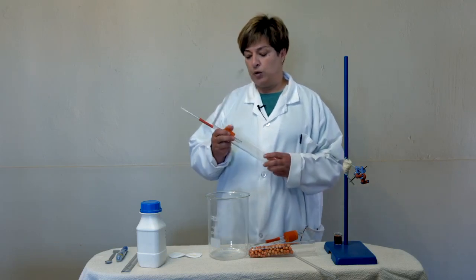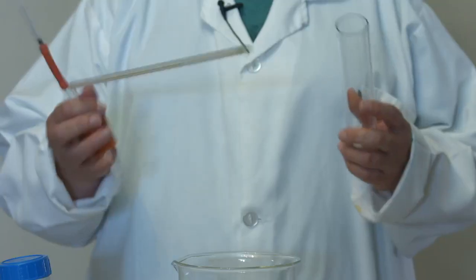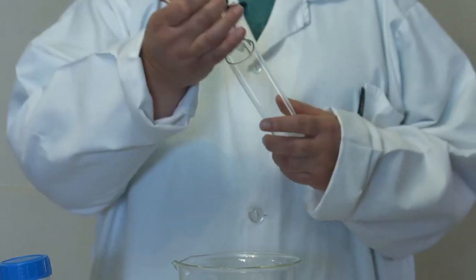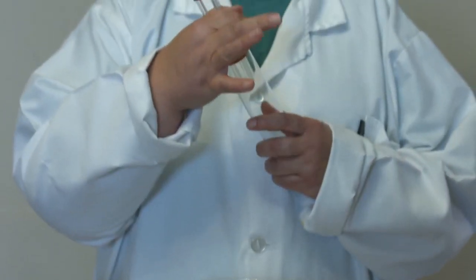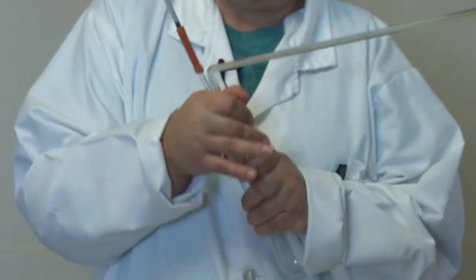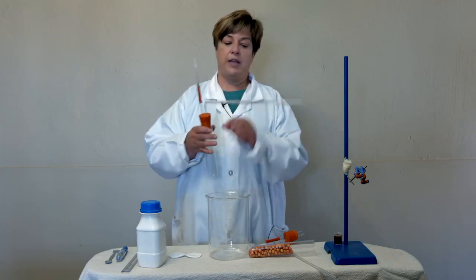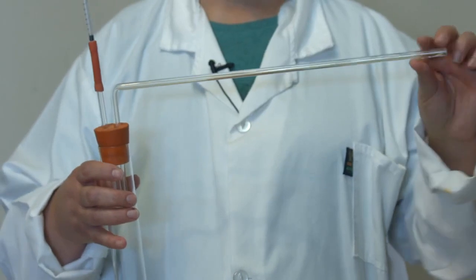How are we going to do that? The thermobarometer is an empty tube with a lid. Now, when we fit the lid, we have to take care to fit it very tightly, and therefore we have to press down and give it a twist. You will see there is a little plunger and syringe here that we can use, and then we have this side arm that is specifically made.